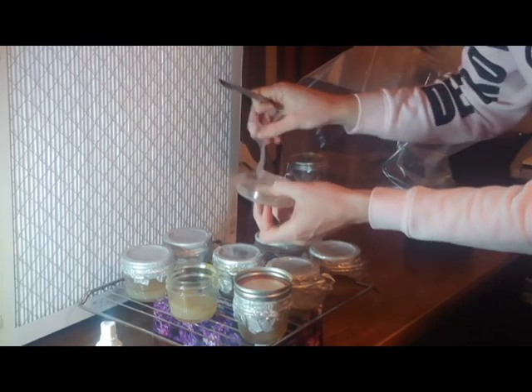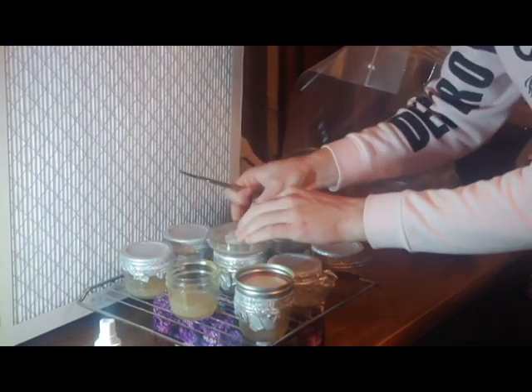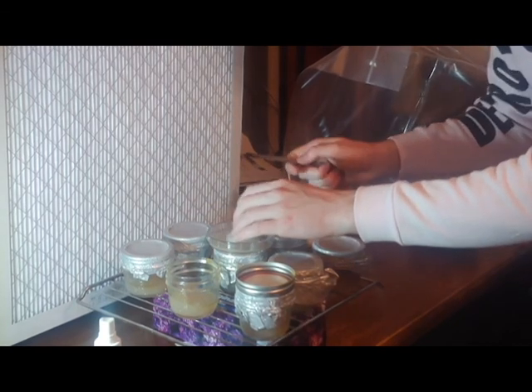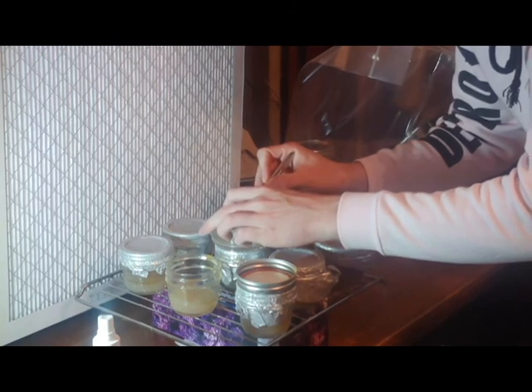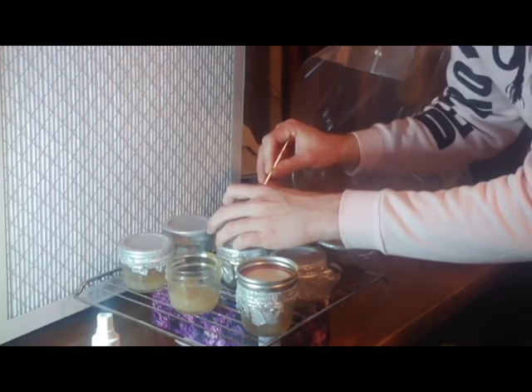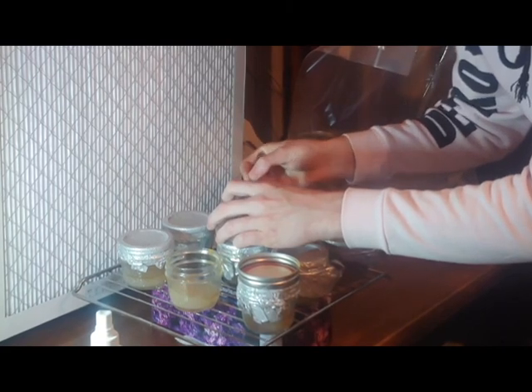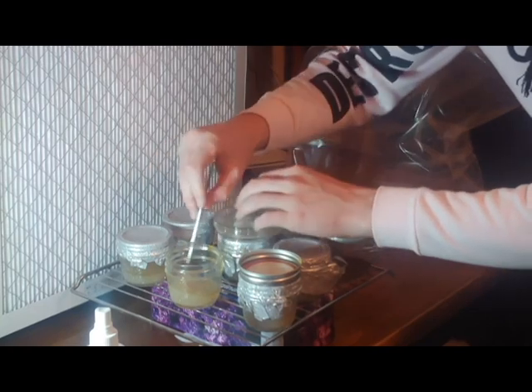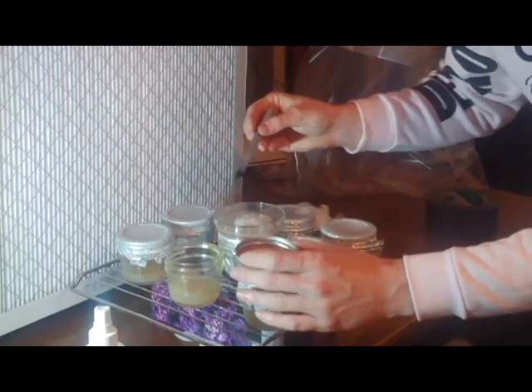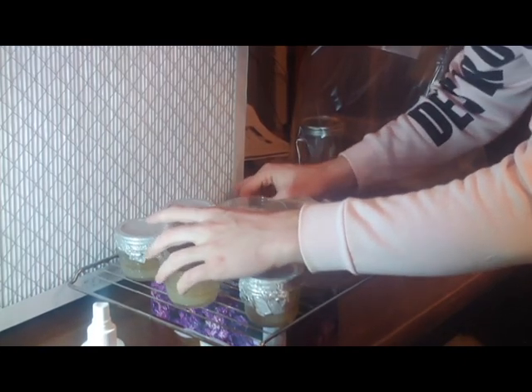This is a culture that I have from a different petri dish project, and I'm just going to be taking a slice and putting it into the wide mouth shallow mason jars, then closing up the mason jars so that the culture can grow on the agar. Just making sure as I'm going along that I'm keeping sterile practice.